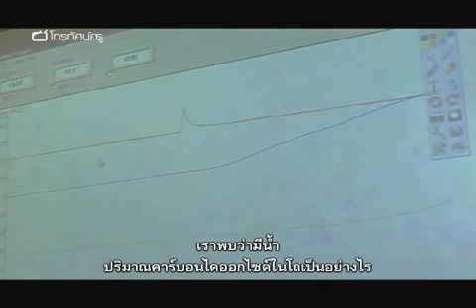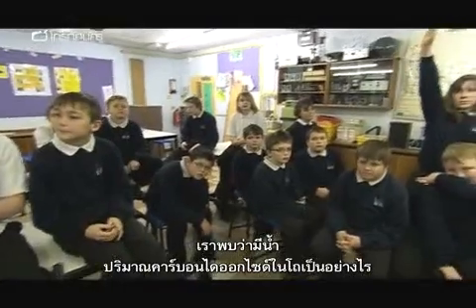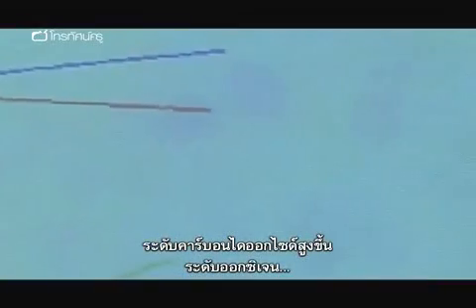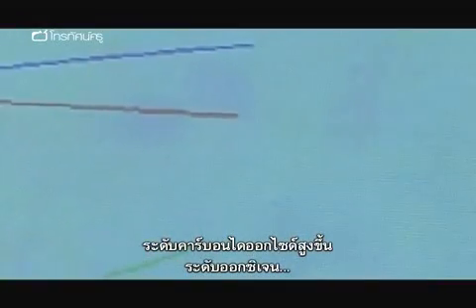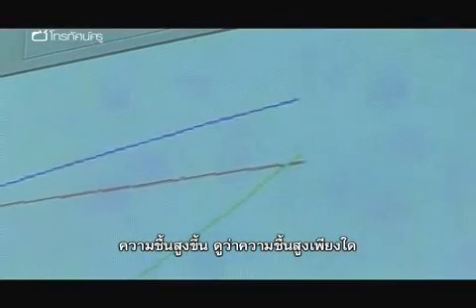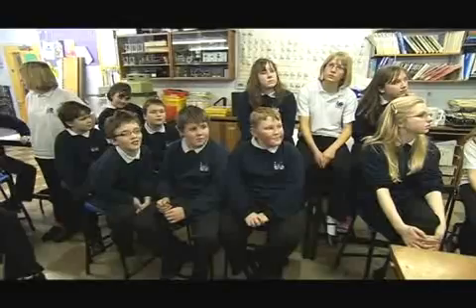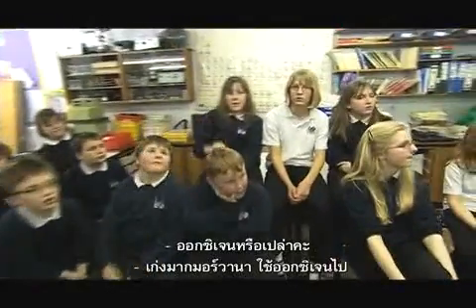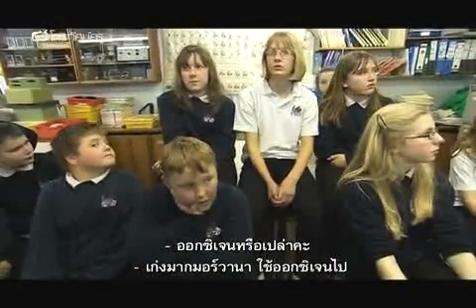What is happening to the amount of carbon dioxide inside the bell jar? It's increasing. Thank you. So the carbon dioxide level is going up. The oxygen level is going down. Thank you. Okay. So the oxygen level is going down. The humidity's gone up high. Look how high the humidity's gone. So what does that mean we are using up? Moana. Is it the oxygen? Well done, Moana. It's the oxygen.